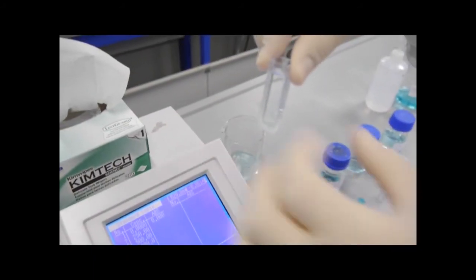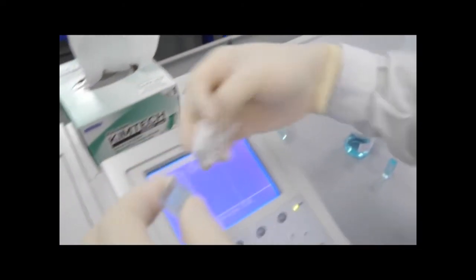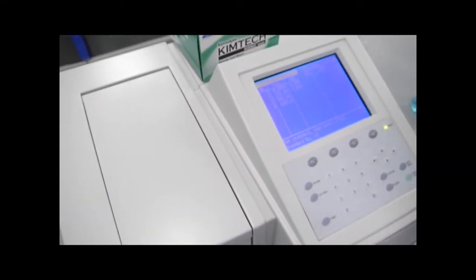After you press auto 0, it will turn 0 0 here, and now you can press start to measure the absorbance. Basically it will still give you 0. After you have done that, place in your 250 ppm standard solution in the cuvette. Same thing, there should be some rinsing before you fill up the cuvettes. Place it into the sample compartment, and press start. Repeat these steps for the rest of your standards.